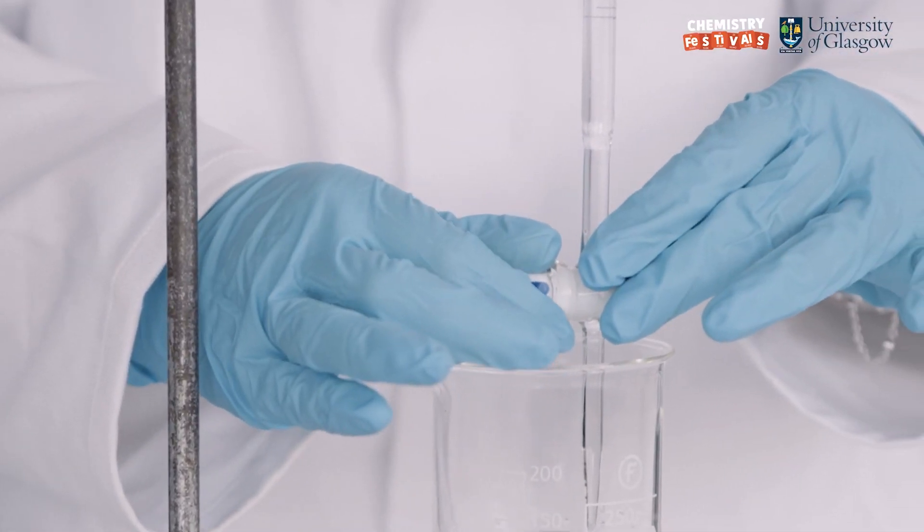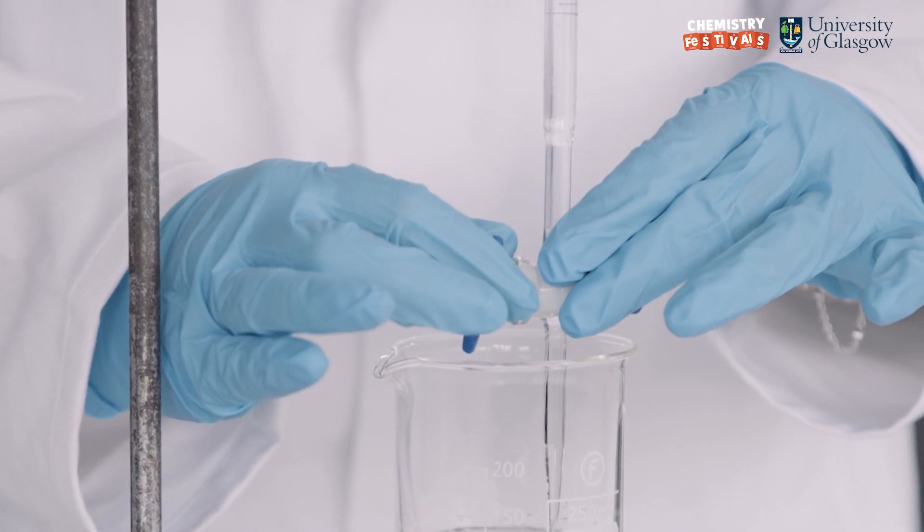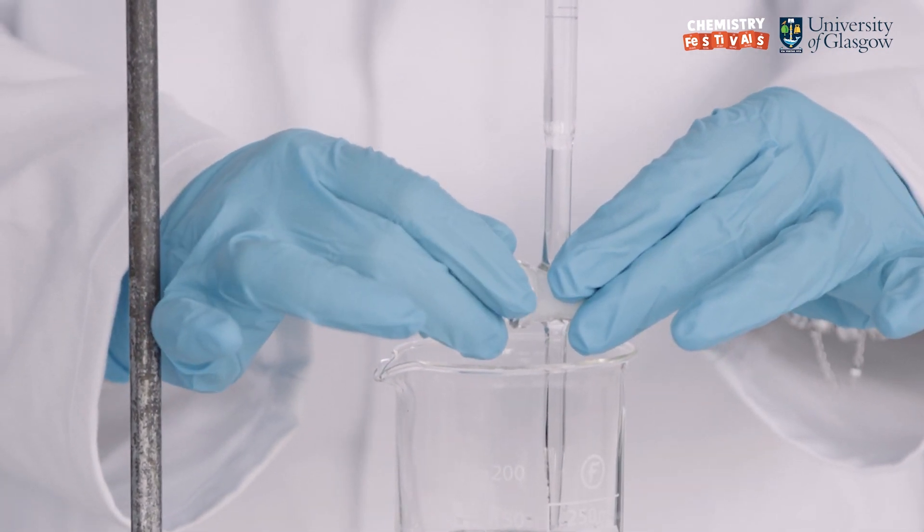I now open the tap and watch the meniscus fall till it reaches the zero point and close the tap.